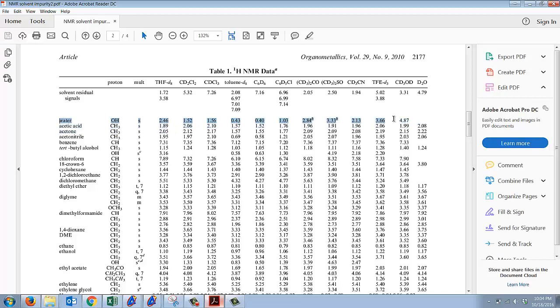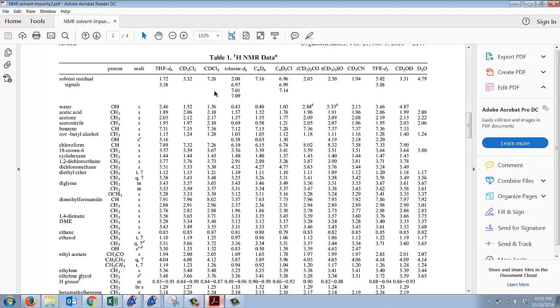If you start looking at this table, these are the various NMR solvents. THF D8 is the first row, then CD2Cl2, so that's deuterated dichloromethane, and chloroform. We're mostly going to do chloroform, or DMSO, which is (CD3)2SO. We're going to focus just on the chloroform part. So if you had water, you would see a broadened OH peak as a singlet at about 1.56 roughly. If you had acetic acid, you're going to see a singlet for CH3 at about 2.1.